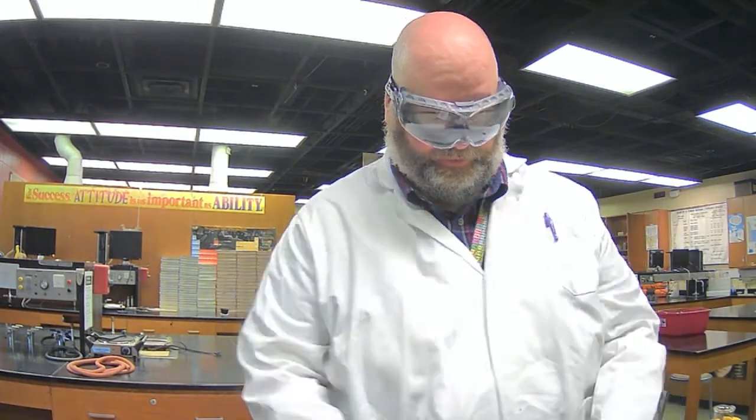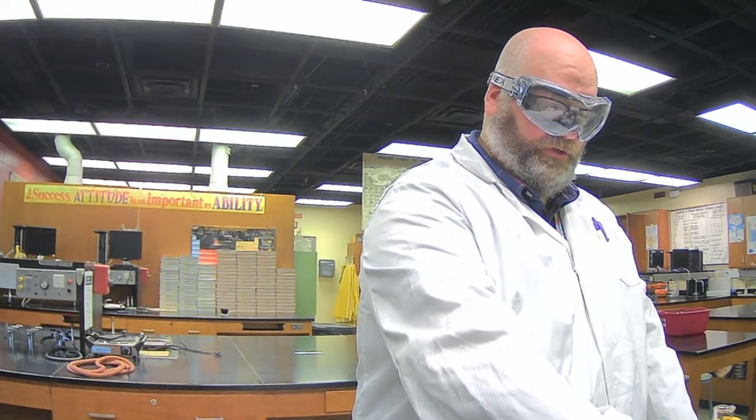53.0 milliliters. Now I'm going to go ahead and do the new pennies, okay, because this is a pretty short video so far. The new pennies, I'm going to drop them into my beaker that's on my scale, and the newer pennies are amassing out to be 15.05 grams.